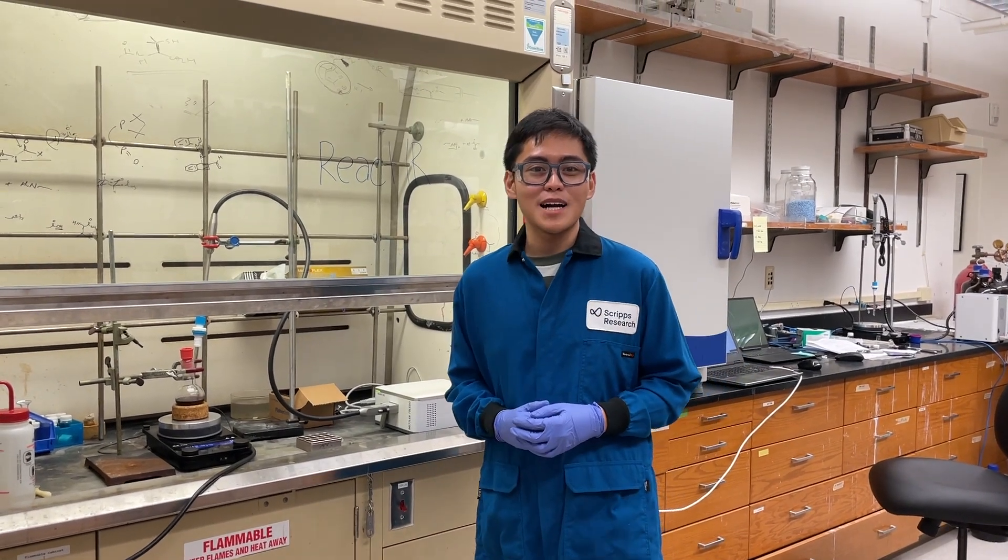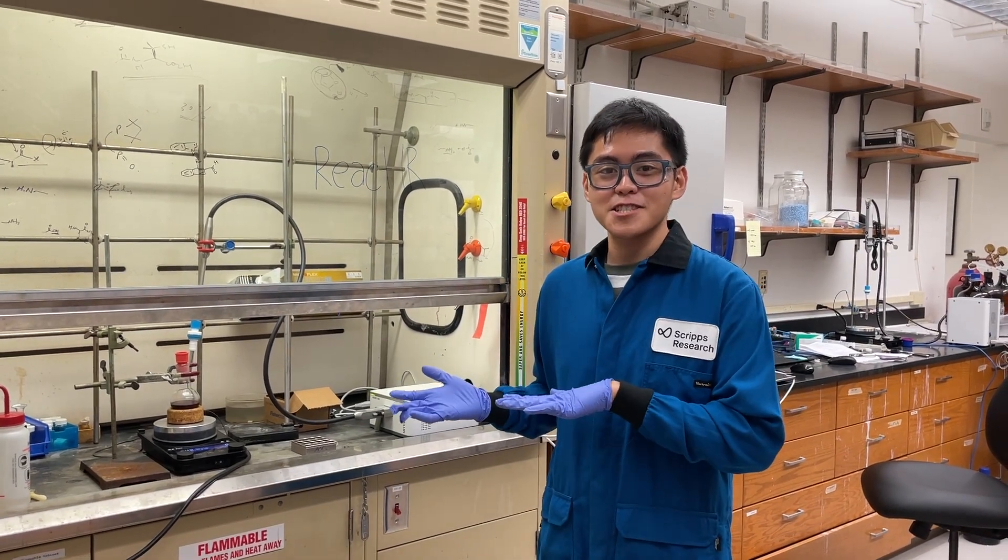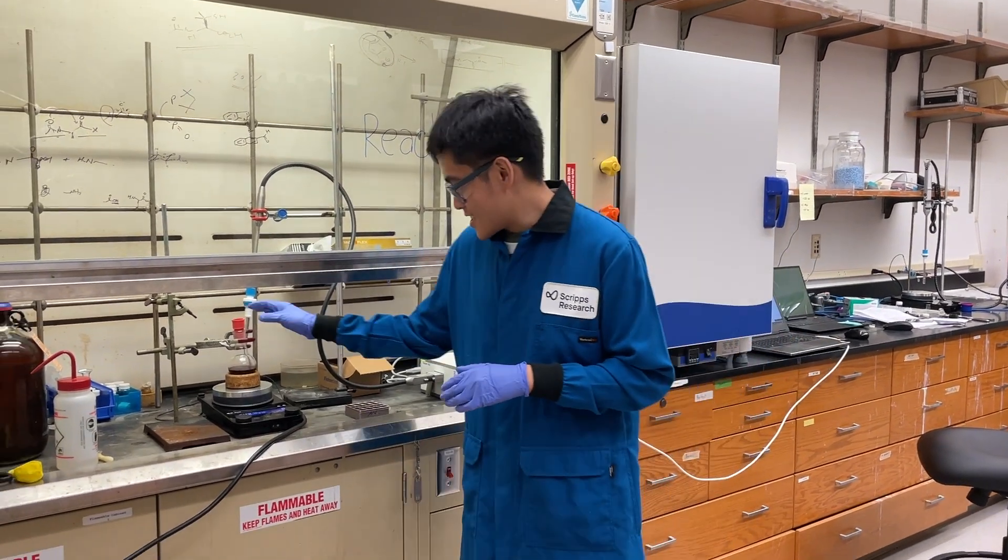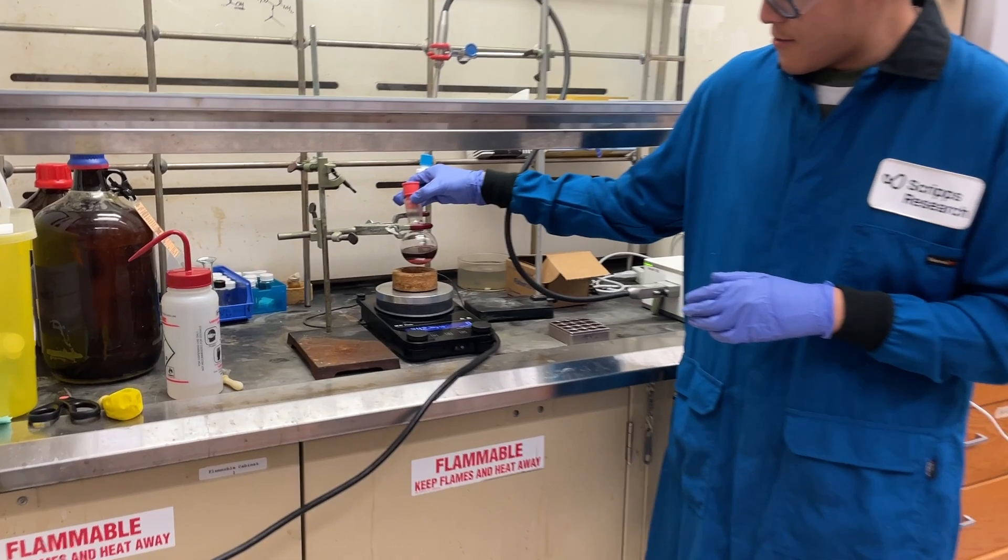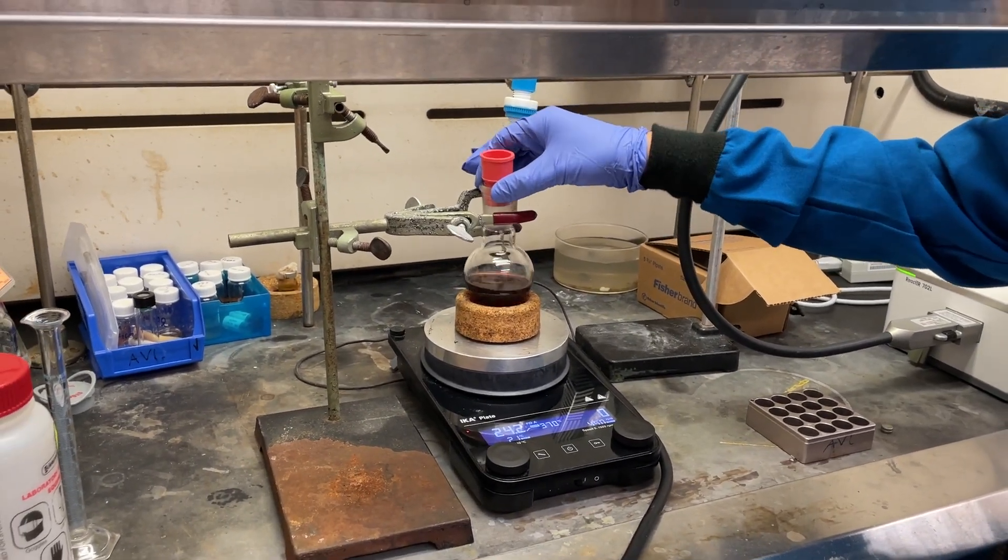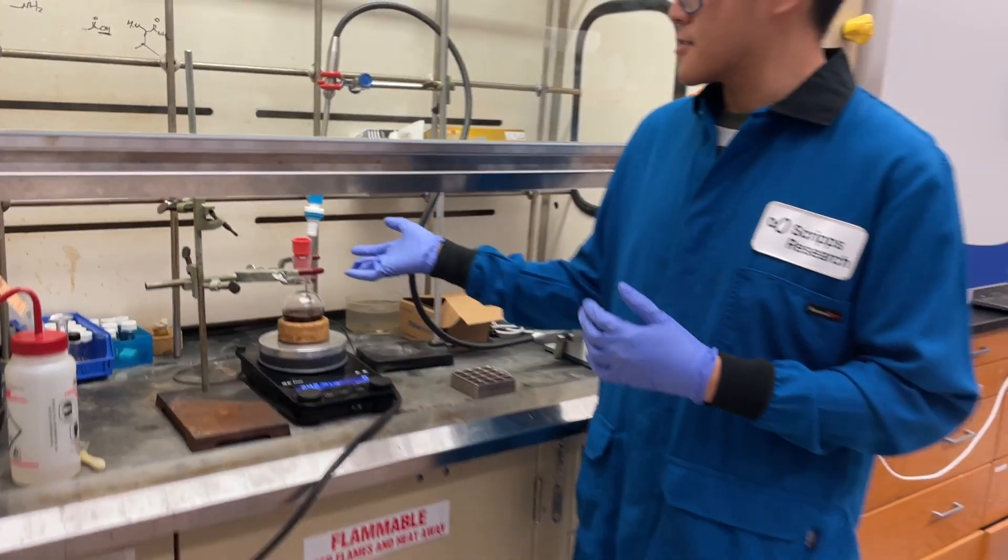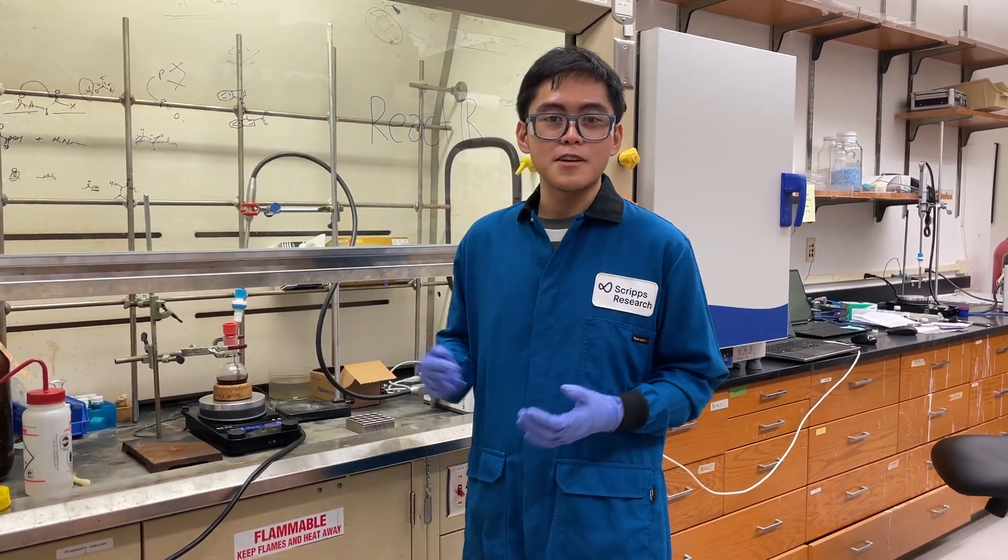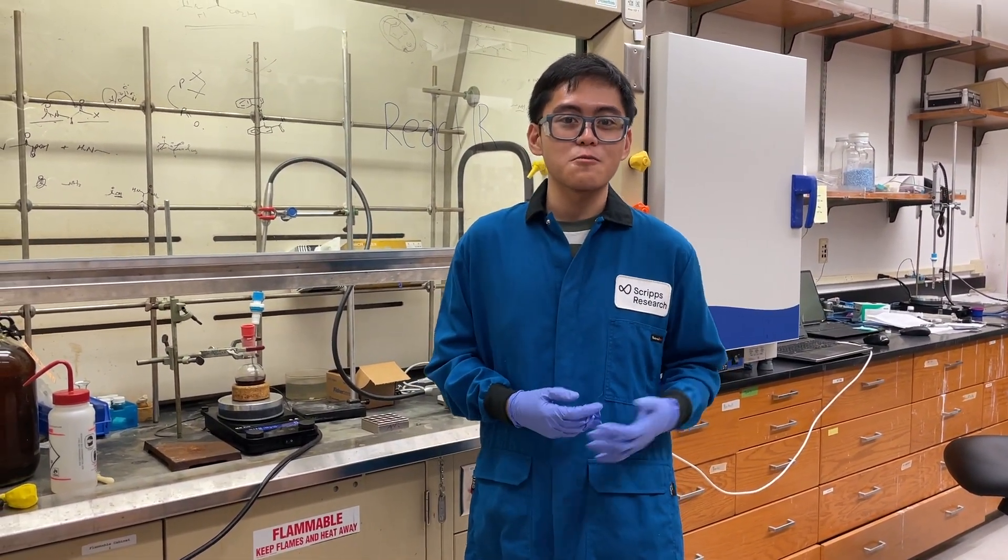Hey everyone, we're back here in the Blackman lab after letting the reaction run overnight, and you can see here that the reaction has now turned into a beautiful red color, and I already stopped it and also rinsed and cleaned the probe. And so now we can take a look at the results on our computer.